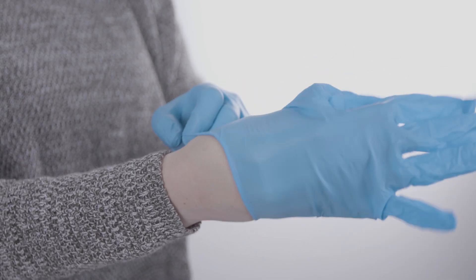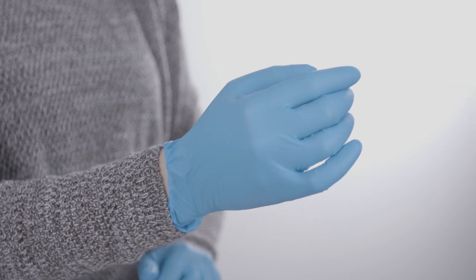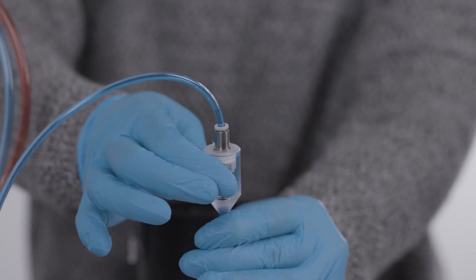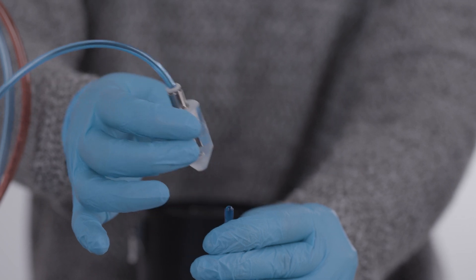To attach the tensio shafts into the sensor unit, use powder-free gloves to avoid touching them. Remove the tensio shafts carefully without tilting them to avoid losing water from the refilling adapters. After degassing, the shafts should be completely filled with degassed water.